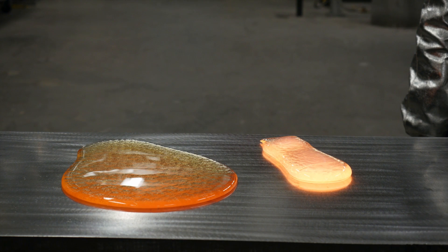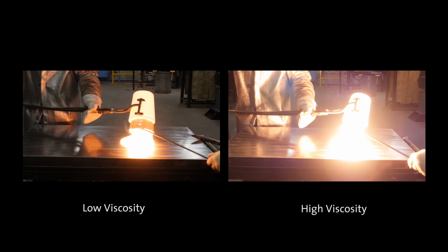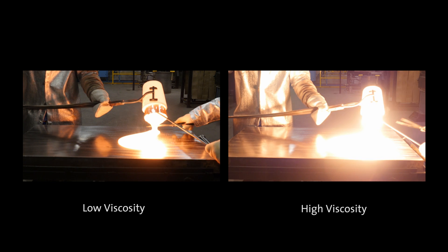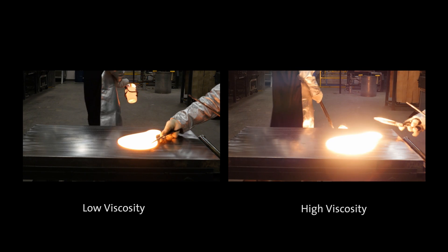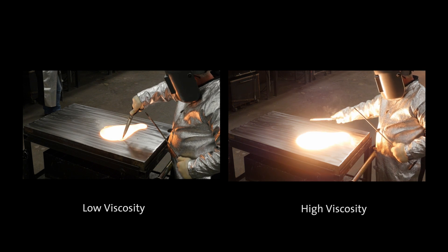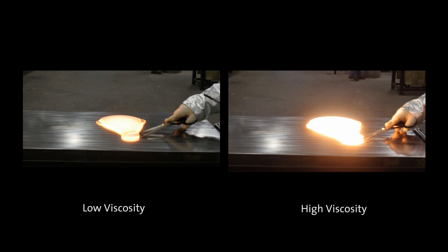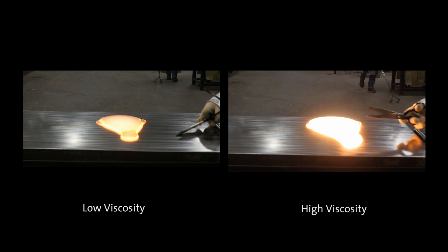So let's look at temperature. Here we've melted the glasses at different temperatures to achieve the same viscosity. The specialty glass on the right was melted at 150 degrees C higher temperature than the soda lime glass on the left. When we increase the temperature of the specialty glass, we decrease the viscosity of the glass, showing the inverse relationship between temperature and viscosity.